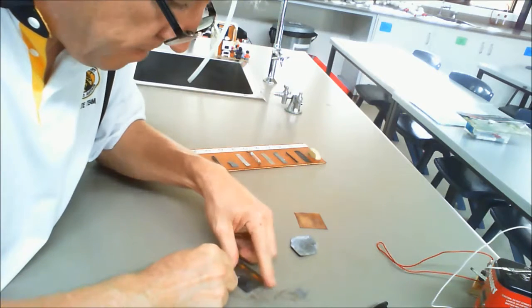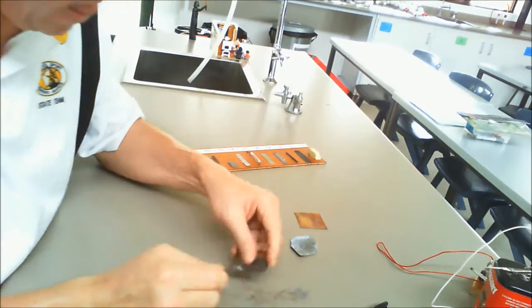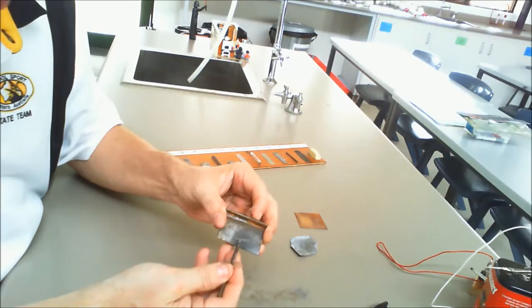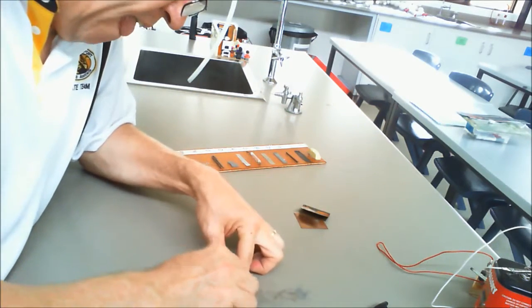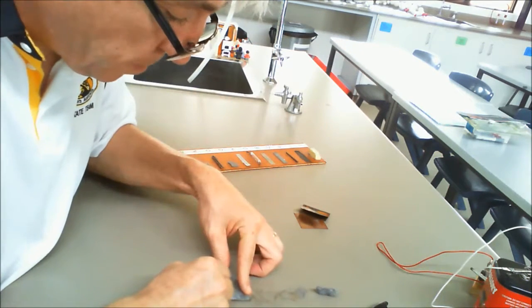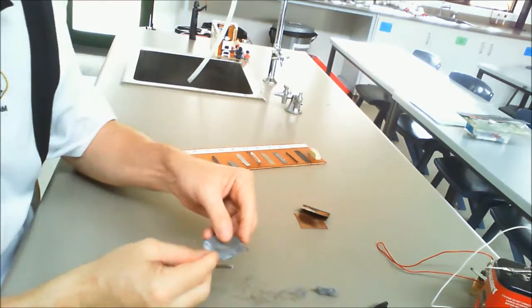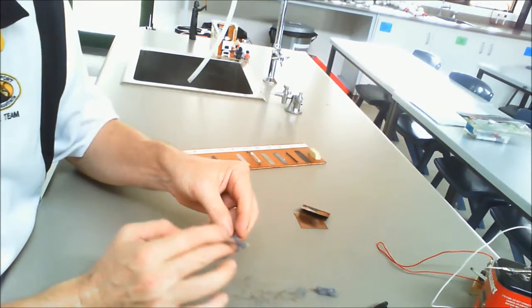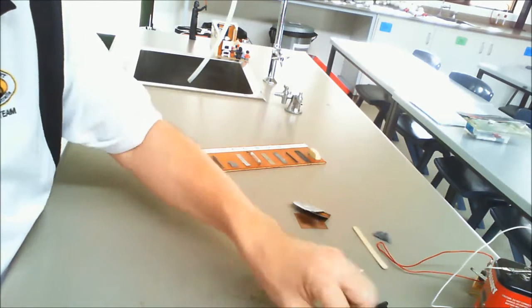I think we'll find exactly the same thing there, that if we get rid of the coating and get underneath it, and we can do that by using this nail here, once again we have shiny underneath where I've scratched it, and dull everywhere else. I'm going to suggest that it's going to be the same here as well. We need to use the nail again. To get rid of the oxide coating, we just need to rub it off. So again we end up with shiny where we rub the oxide coating off, and dull where we don't. So that's another feature of metals and non-metals.